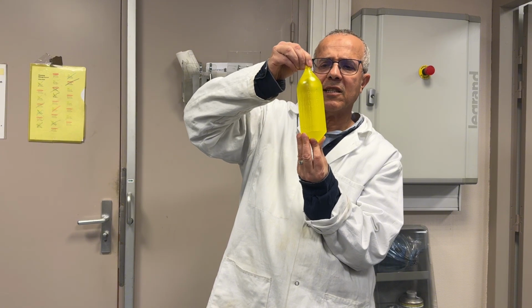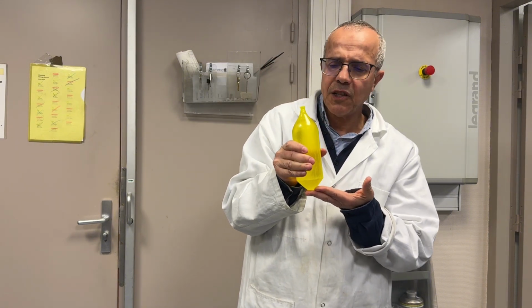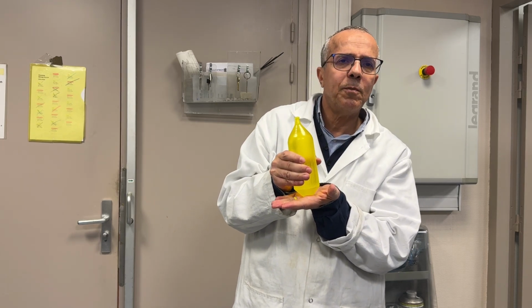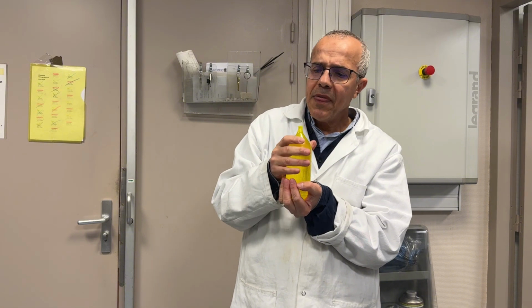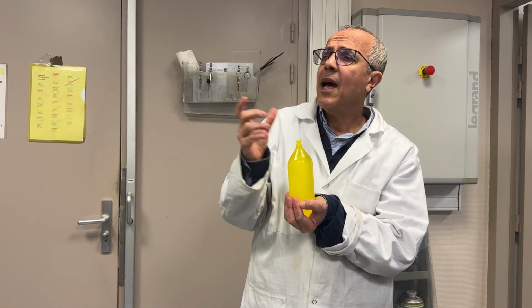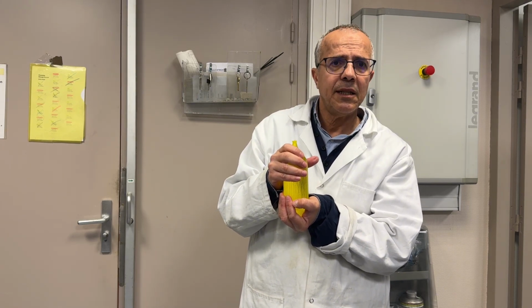It is a good crystal. It is transparent. It doesn't contain defects such as cracks and even bubbles, because we have already cut a piece of this crystal and we did some characterization. So now we are also working to prepare other compositions, and they will soon be grown by the Czochralski technique.